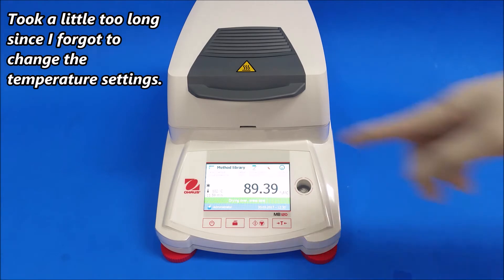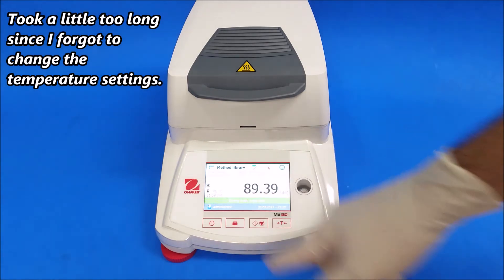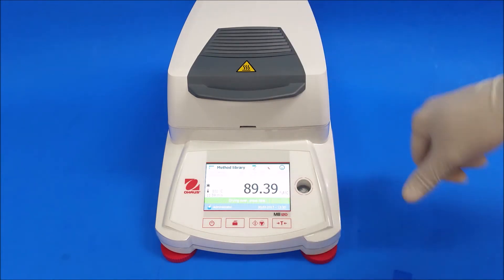Alright, once it's finished, the Ohaus will give you your results, your time, and the temperature should be dropping down. It's cooling down again.